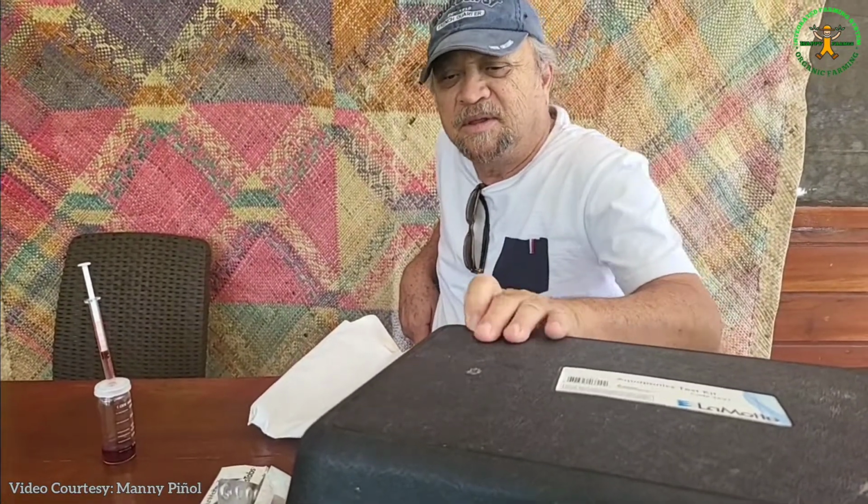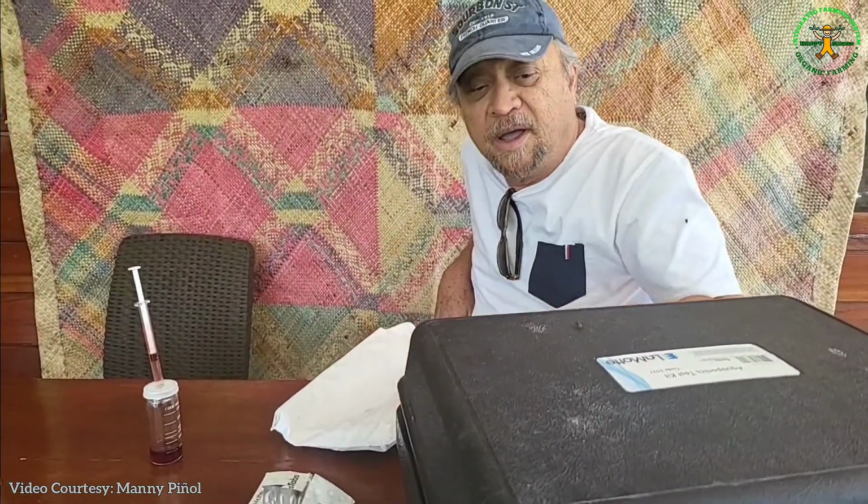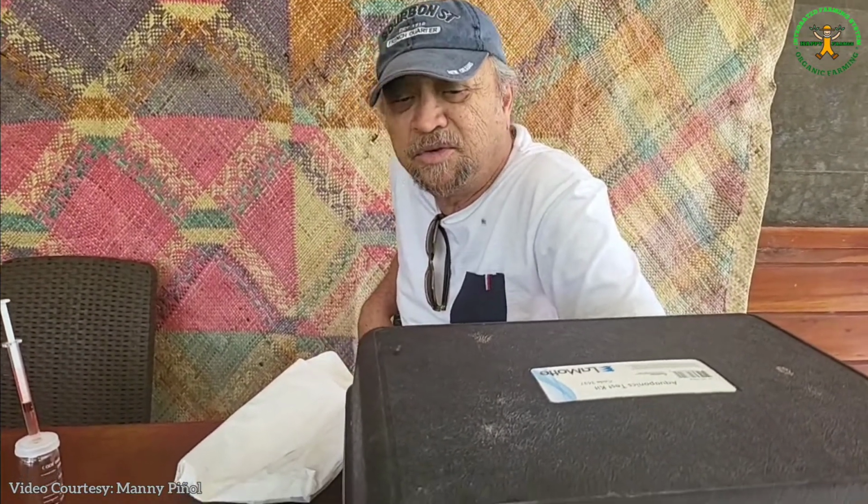Yeah, there's even a more sophisticated kit which is really designed for fish farmers. They call it the fish farmer freshwater kit, and then you have another kit for the salt water. And I could teach a 9-year-old to do this in a matter of minutes. You don't need scientists to do this. You don't need to go anywhere. You just buy the kit, follow the rules, and then it'll guide you what to do in your next venture.